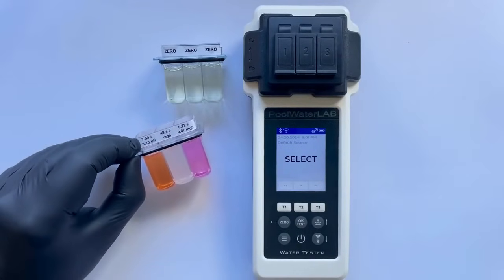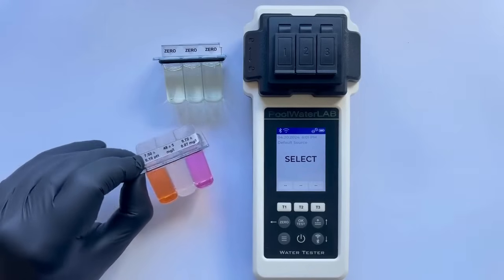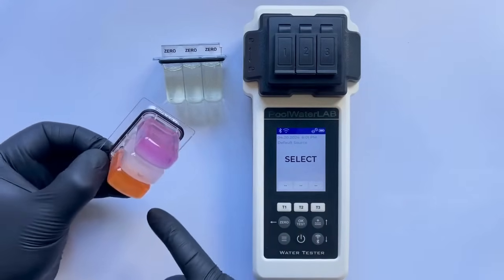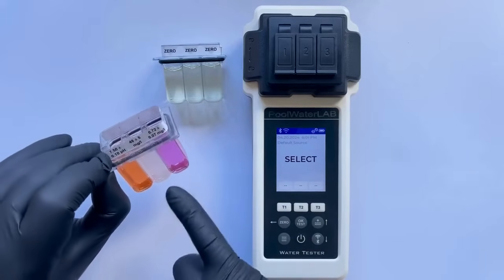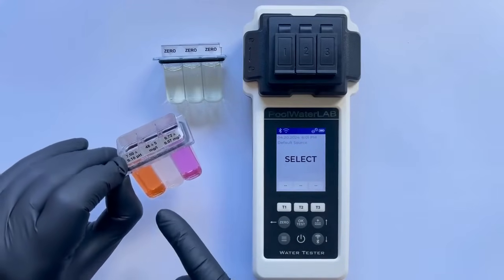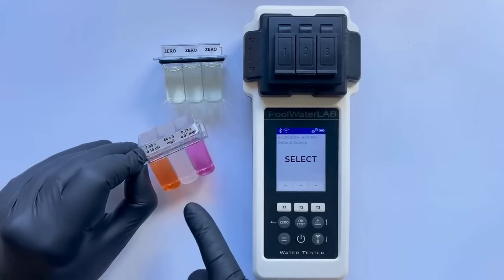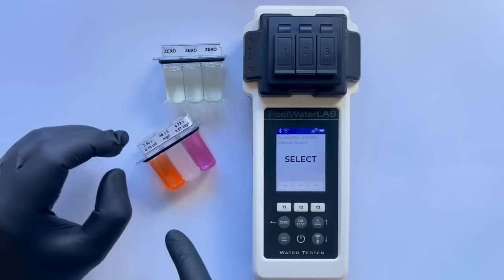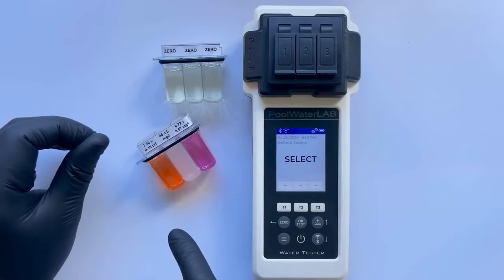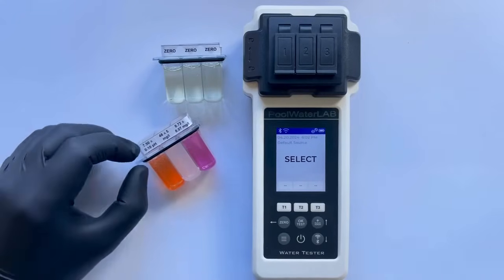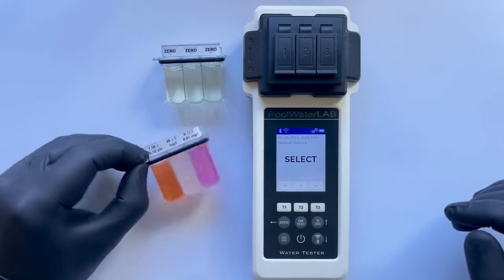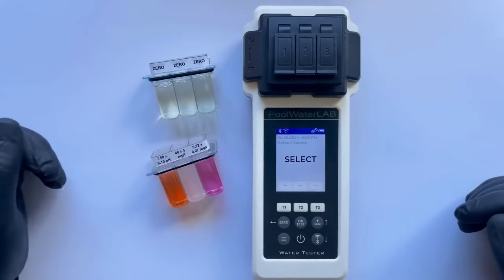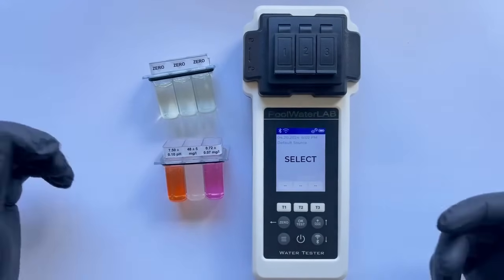Before testing any samples or conducting tests, ensure the cuvette is always clean on the outside. You should gently wipe it with a soft, lint-free cloth to remove any fingerprints or other marks. Contaminants on the cuvette can adversely affect the results. Even a small fingerprint can cause light to refract improperly, leading the tester to provide incorrect results. Our samples have already been pre-wiped. They are thoroughly clean. Therefore, we can proceed directly to testing.